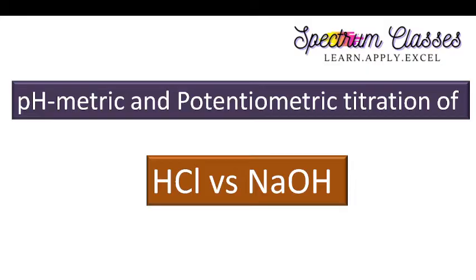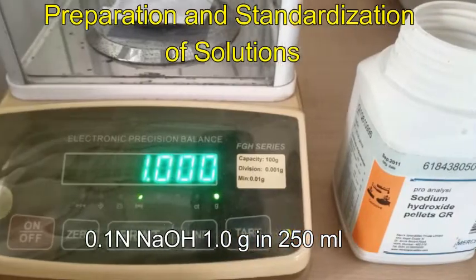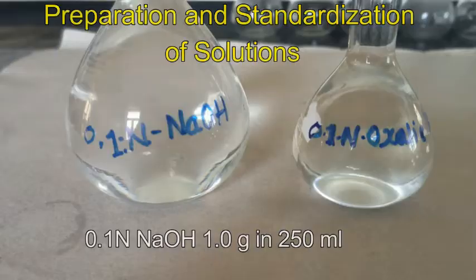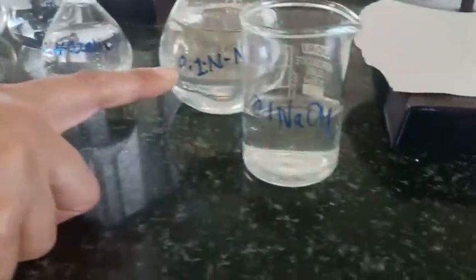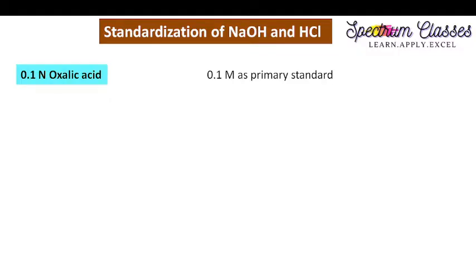Before that, I am showing you the solutions I have taken for this titration. I am going to prepare oxalic acid 0.1 normal and NaOH 0.1 normal. For preparing NaOH I have taken 1 gram of NaOH in 250 ml, and 0.63 gram in 100 ml oxalic acid. These are the solutions I have prepared — 0.1 normal.